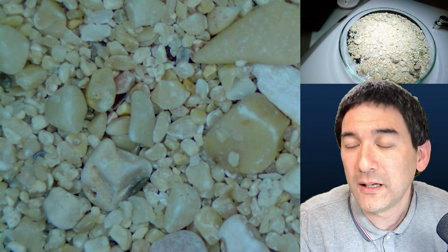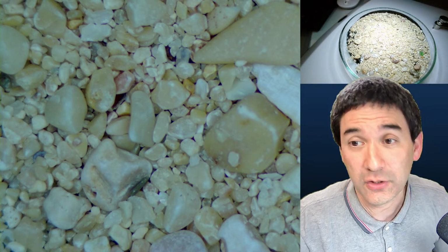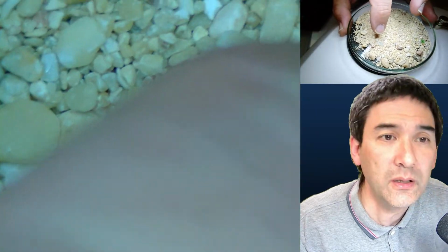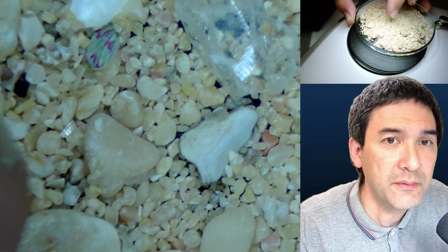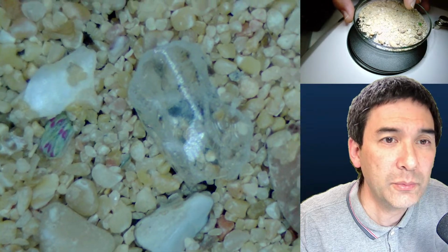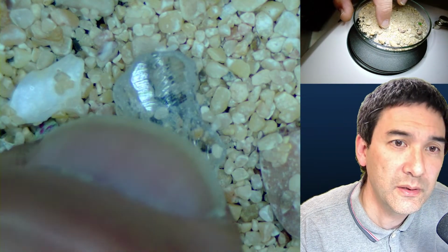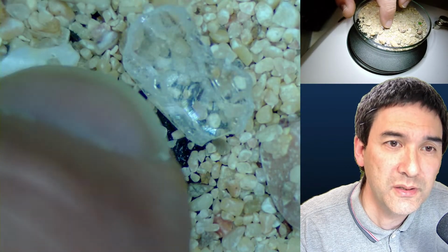Okay, yeah, it's not always glass. That could be, but I did see some green pieces as well. I don't know about this one here. One would have to check a little bit. Sometimes it's glass, sometimes it might be some other minerals.